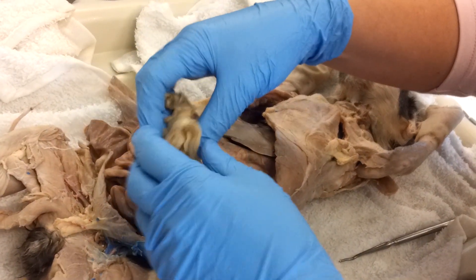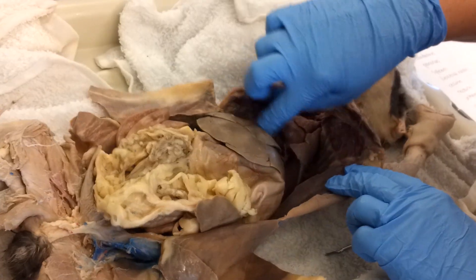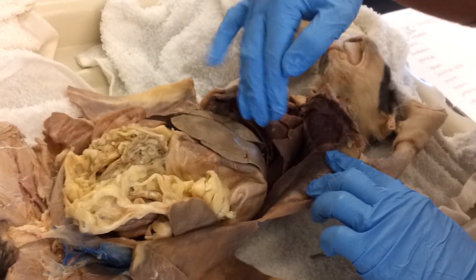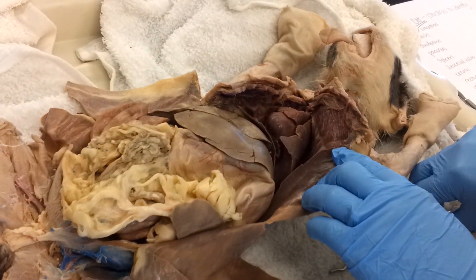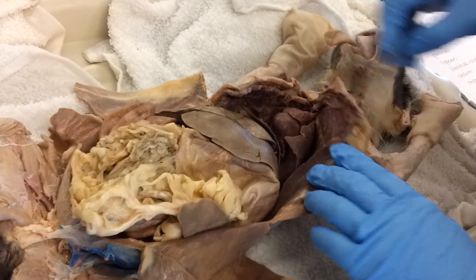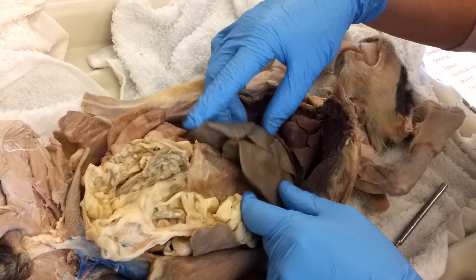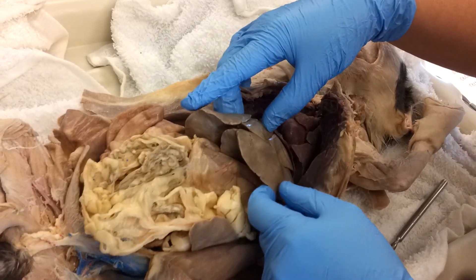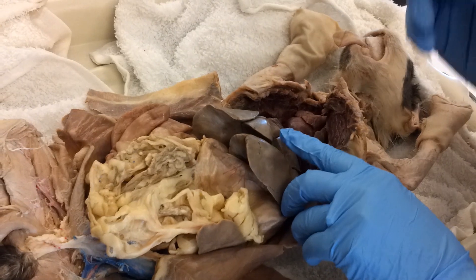Starting up here, this strong muscle that's been cut is the diaphragm. The diaphragm and downward is the abdominal cavity. You can see this cat's liver, which is this strong, hard tissue. Cats have more lobes in their liver than we do, so that makes it look a little bit different.